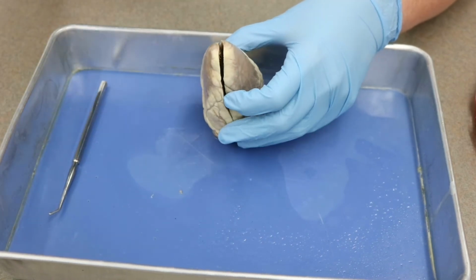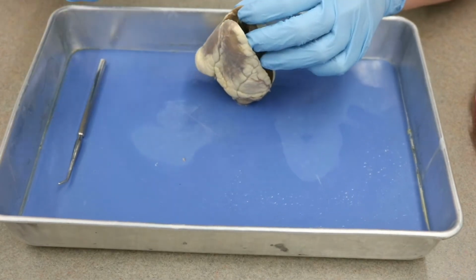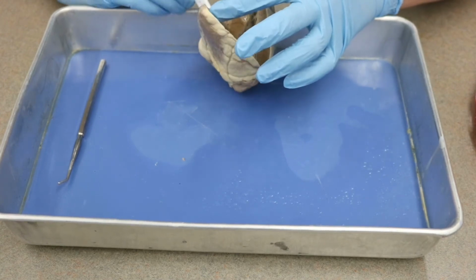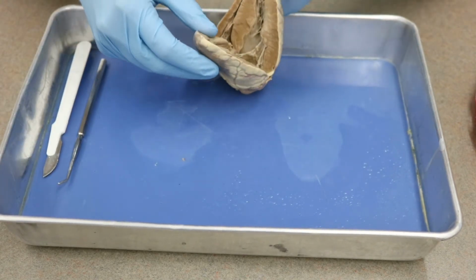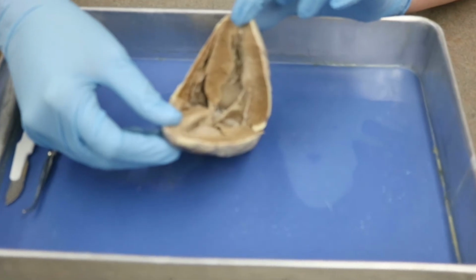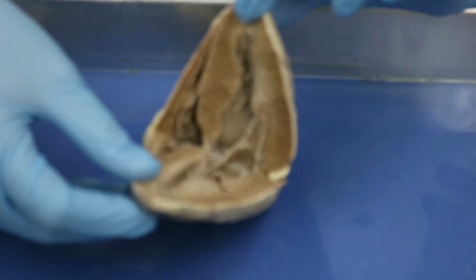So what we need to do now, very carefully, pulling it open, and I can't show you and do this carefully myself, so I'm going to have to look down myself here and just cut down any tissue that is holding it back. Okay, so I'm going to go ahead and open it up here, and you can see how this looks. We've just cut through. This is, of course, a coronal or frontal cut of the sheep heart.